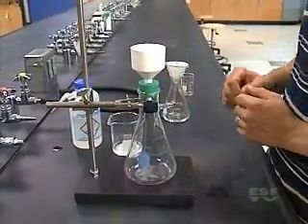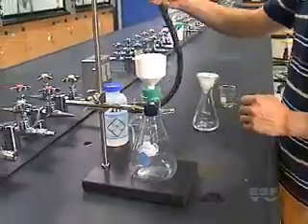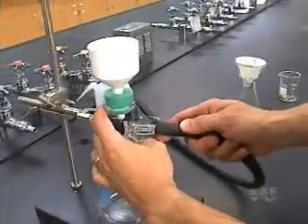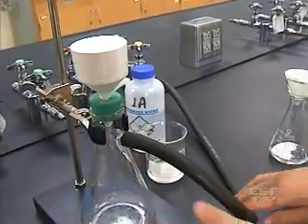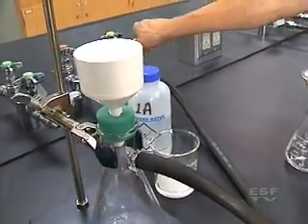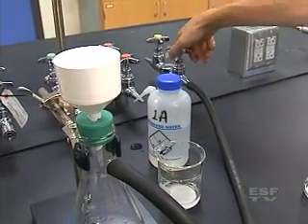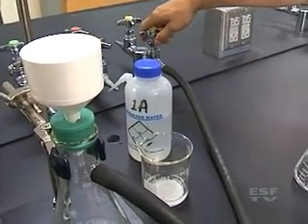And now I need to connect it to my vacuum line. And the vacuum line is connected by a piece of rubber hosing that you'll find in lab. And I can just connect that onto the filter flask. And that traces back to the vacuum line. And you'll find these vacuum lines all throughout lab. And as I turn it on you'll start to hear a vacuum being pulled.